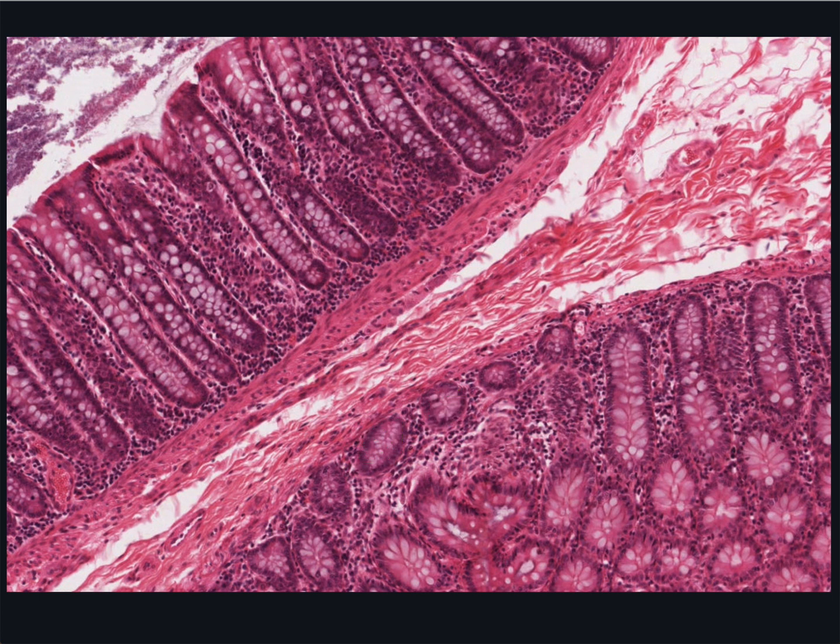However, if you look at an area down here where the knife is cut parallel to the surface, you can see that there are glands organised in a regular pattern with a small sheet of connective tissue between them. Clearly, the epithelium extends down into the lamina propria instead of protruding upwards over villi.